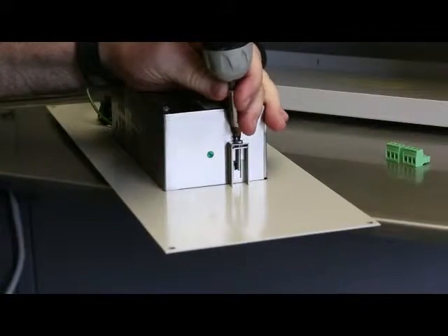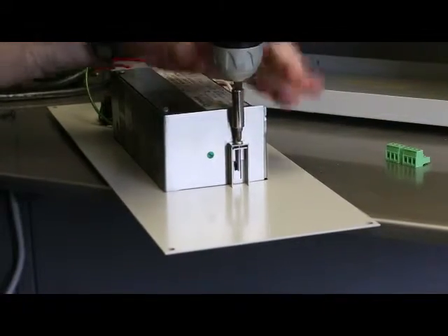Using a Phillips screwdriver, remove the four mounting brackets and then slide the controller out of the panel.